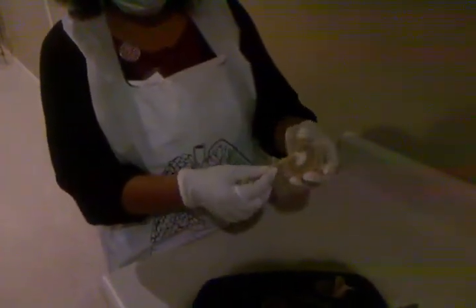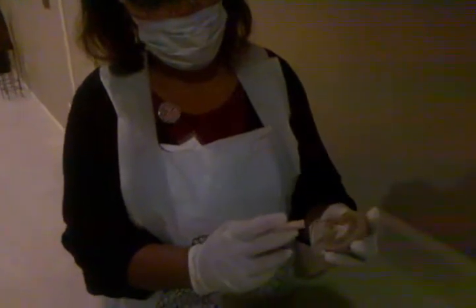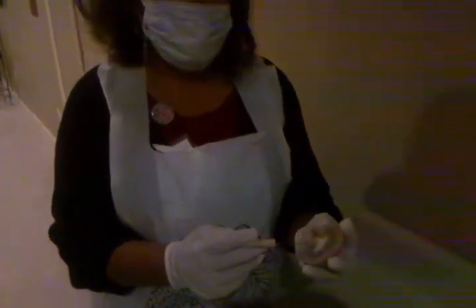Here we have our ureter, which is where the kidney drains to leave the body. With our kidney, we have two major regions. We have the outer cortex, which is the lighter area, which goes from here around to here. Then the darker region on the inside is the medulla. The medulla is surrounded by the renal sinus, which is this area up in here. Within our medulla, we have cone-shaped structures called pyramids.